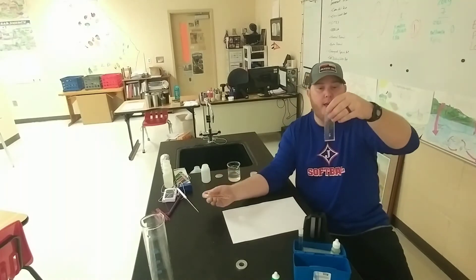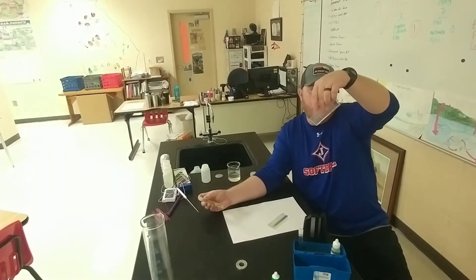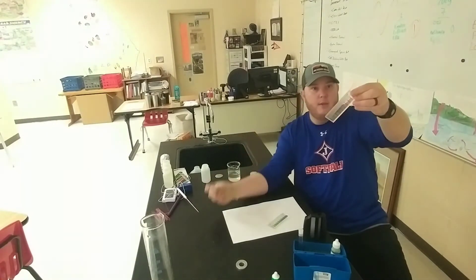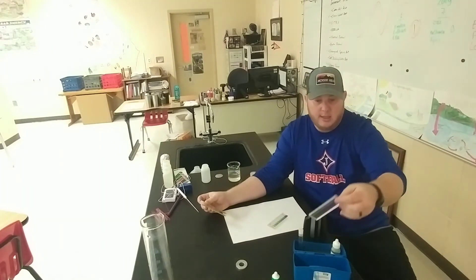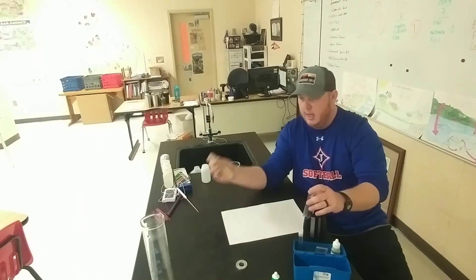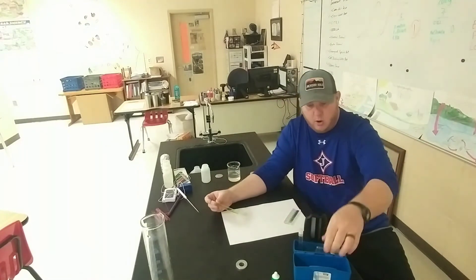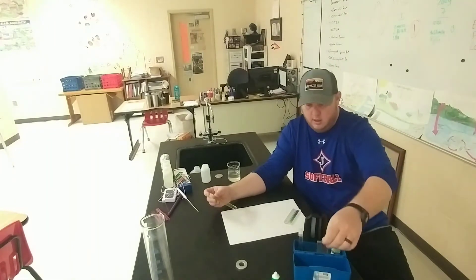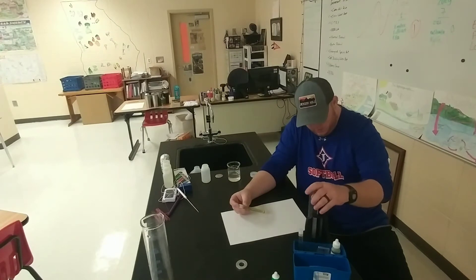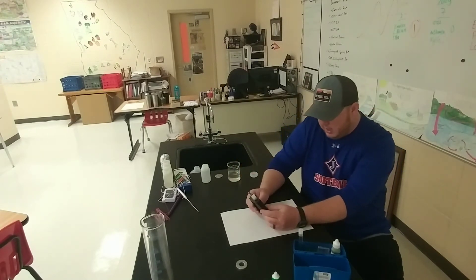In the meantime as we're mixing it, this indicator comes with two little slides: one is from a pH of 7 to 10.5, the other is from 3 to 6.5. Basically what you do is match the color. We're expecting a little bit above neutral — seven — and it's a little bit greenish-yellow, so we'll use the 7 to 10.5 slide instead of the one showing orangish-yellow. I can see more green, so I'll put this in and slide the comparison in right beside it to compare.